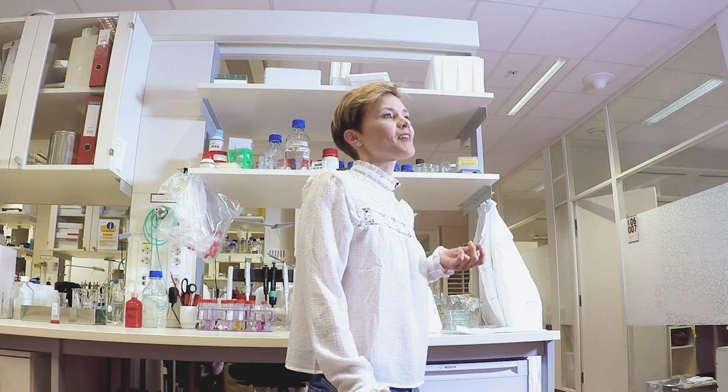I have a huge positive bias toward the zebrafish because it is a model organism I have worked with myself, and it has remained my favourite. I think the fact that you can observe development live under the microscope, combined with the fact that it is a vertebrate, is absolutely fascinating. Today we have learned how to cross fish, how to manipulate embryos, and how to do behavioural analysis. This tour has been excellent.